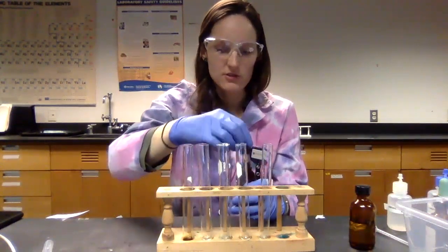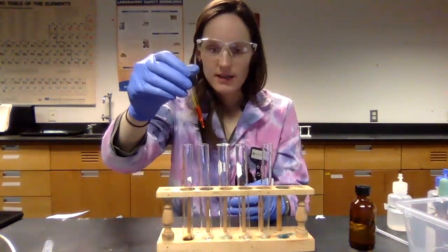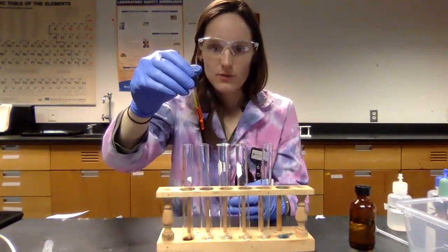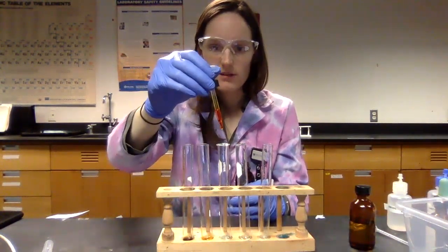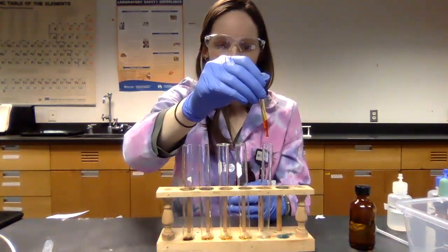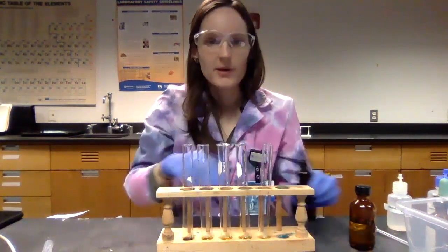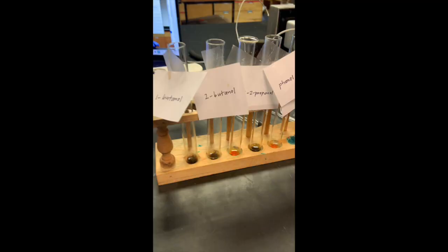So I think I'm going to just do 1 drop in each, but I should have done 2 ideally. So 1 drop in there, drop in there. All right, I'm going to pause the video and show you a close-up of what I'm looking at.